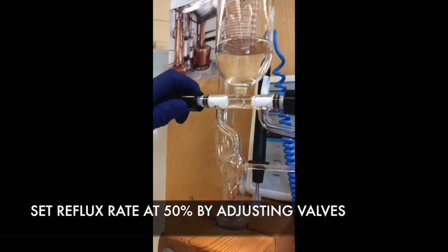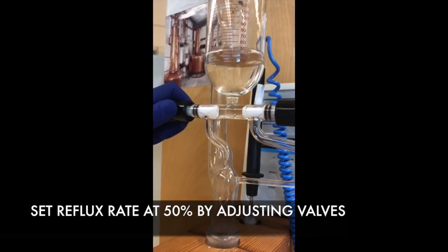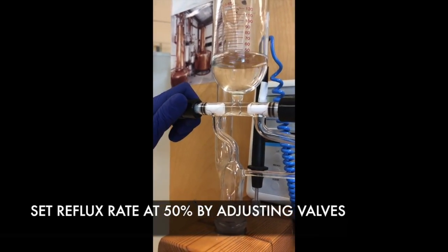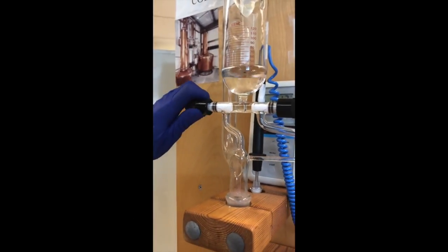One of the key aspects of this lab is looking at the flow rate of the vapor through the column. To carry this out, we'll set the reflux ratio at 50% by opening the valve on the left and using the valve on the right to adjust the flow rate until we have what we want. At this point, the distillate rate should be about half of the boil-up rate.